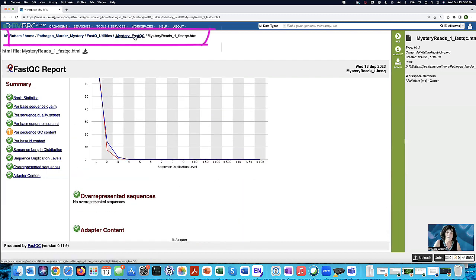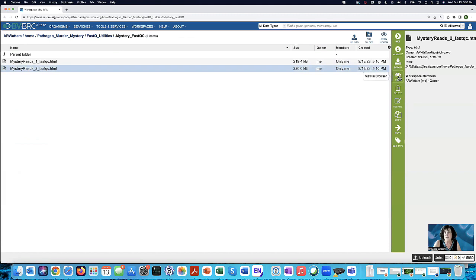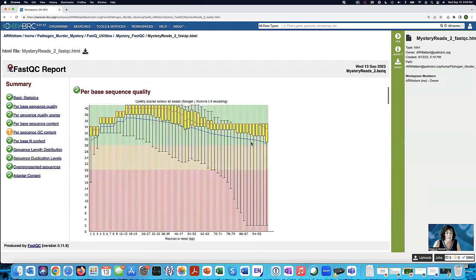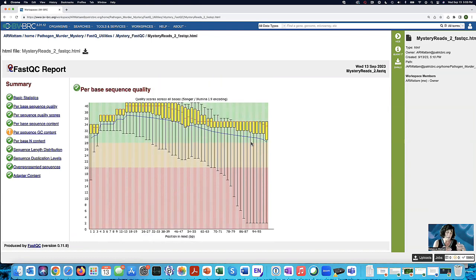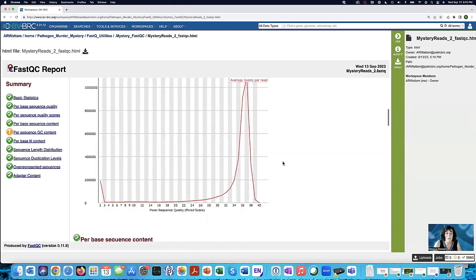This is a breadcrumb at the back, so I can go back to my job folder, click there, and let's take a quick look at mystery read 2. And we need to click the view icon, and then, well, this one looks good too. This isn't bad. Look at that. Sometimes you'll find when you have paired reads, one will be good and the other will be kind of minimal quality. Both these look good. We should be thrilled.